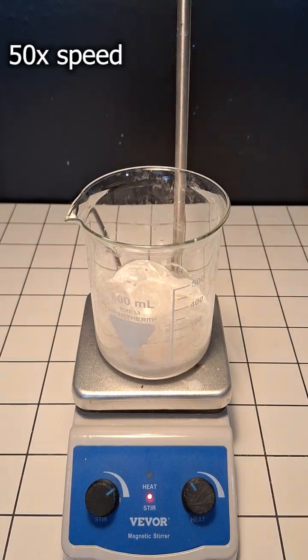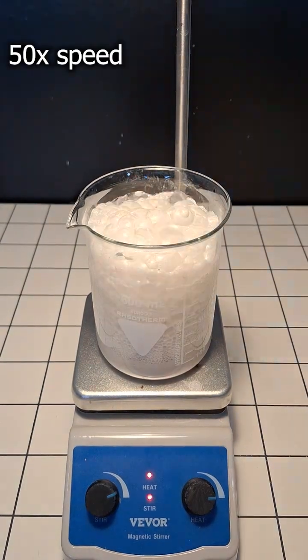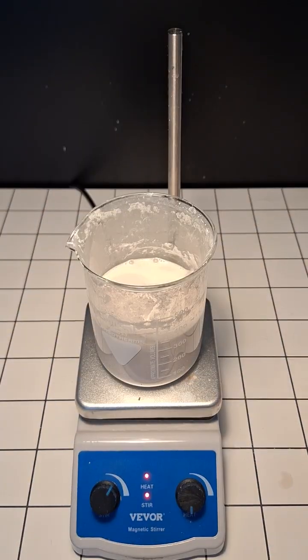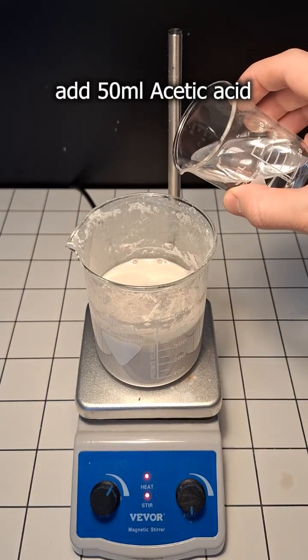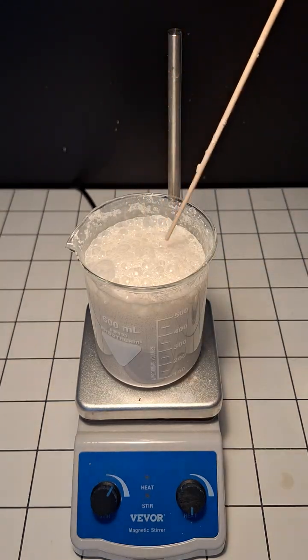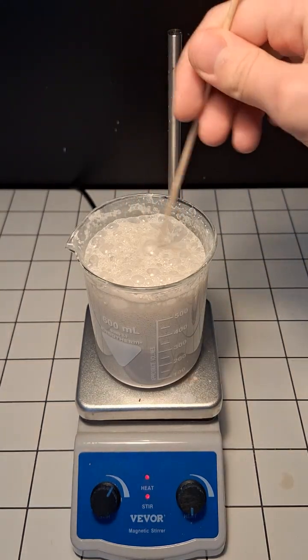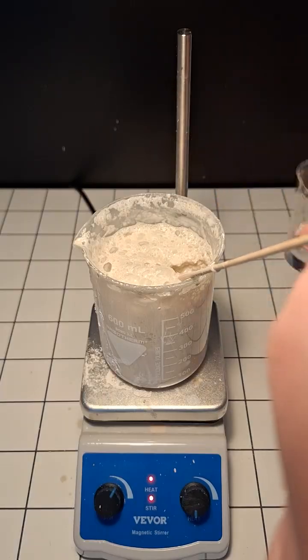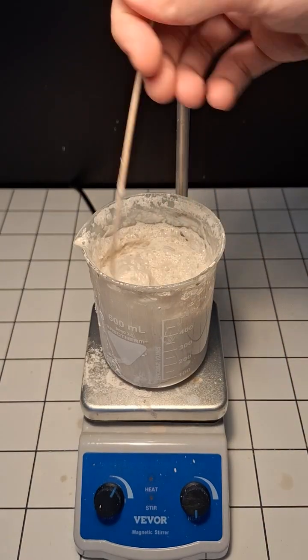gas. Due to all of the CO2, it was foaming quite a lot, and all of the calcium carbonate has to be added quite slowly. Eventually, I added all of the calcium carbonate, however, I still need to add another 50 ml of the acid. It again started foaming quite a lot, and because of this, the acid needs to be added very slowly and carefully. However, I ended up getting a bit careless, and well, this happened.